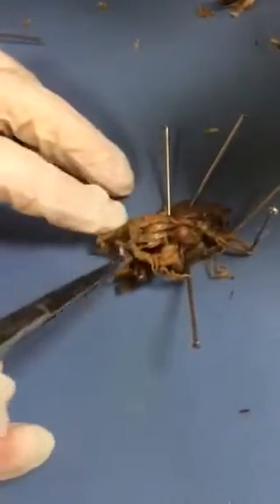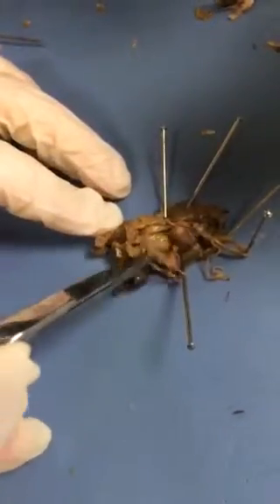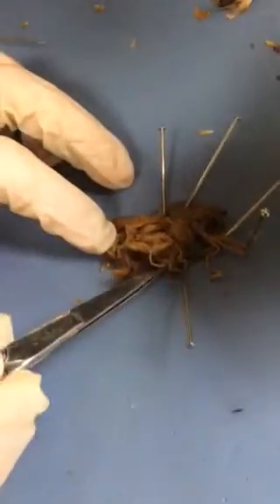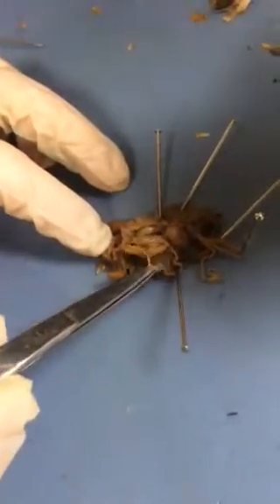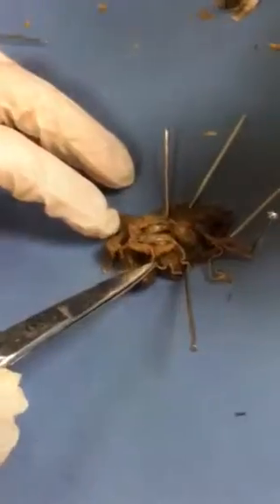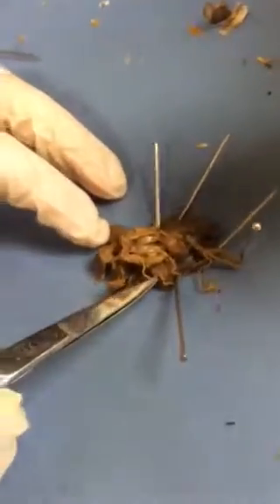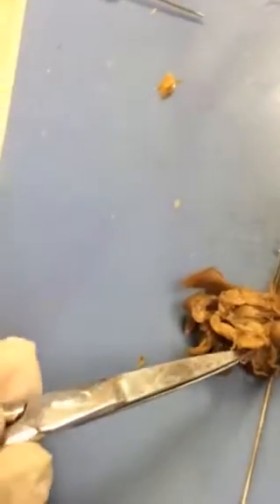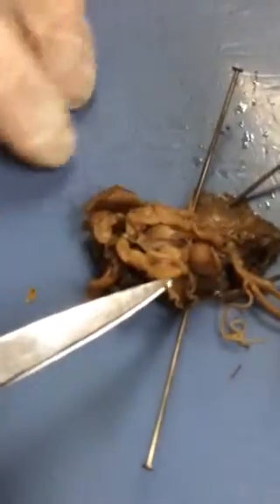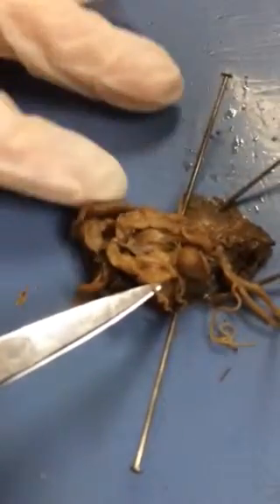And then we go down, and here — this stringy thing — it was the oviduct. This stringy thing, which was all coiled together, is the oviduct.